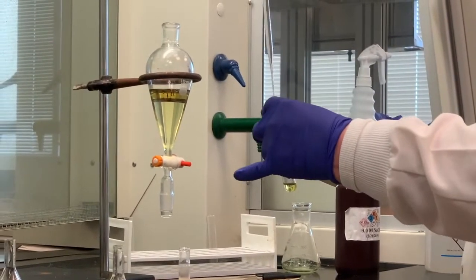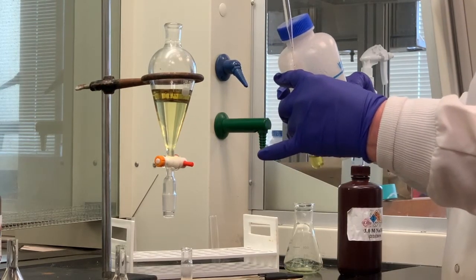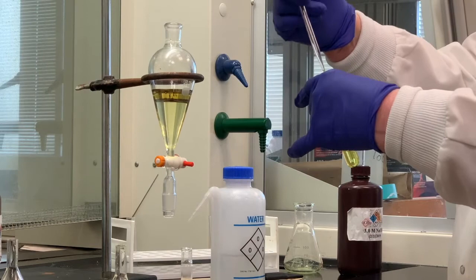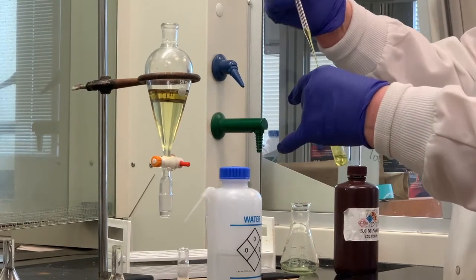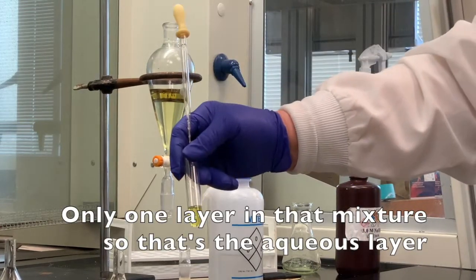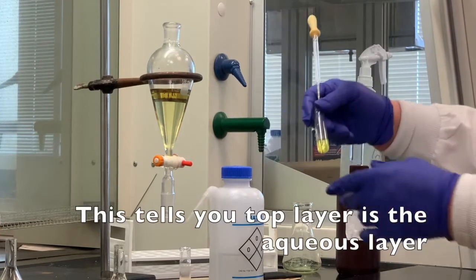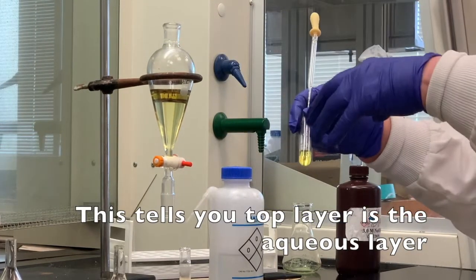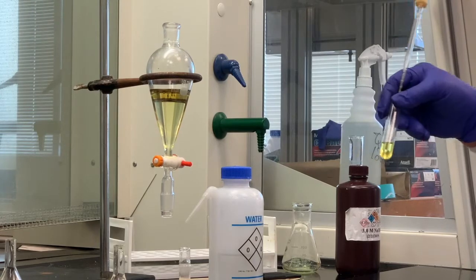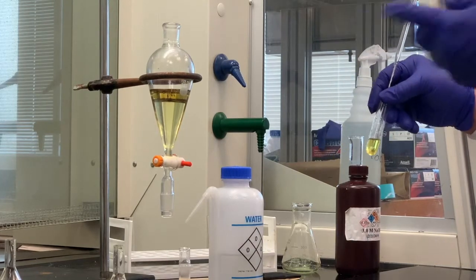What I'm trying to find out is which is the aqueous layer and which is the organic. I'm going to add some distilled water to that, and use the pipette to mix everything together. And as you can see, there is only one layer in that mixture. So what does that tell me? If I add water to the top layer and it dissolves in water, then it must be the aqueous layer. So I know the top layer now is my aqueous layer. I'm going to be more specific and say aqueous acid layer, because that's where the water came from, from the addition of the HCl.